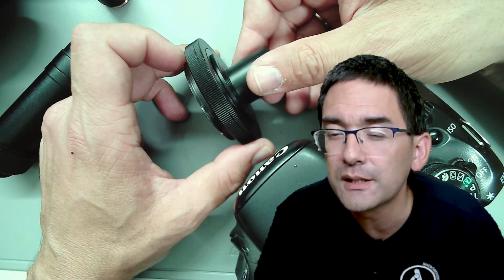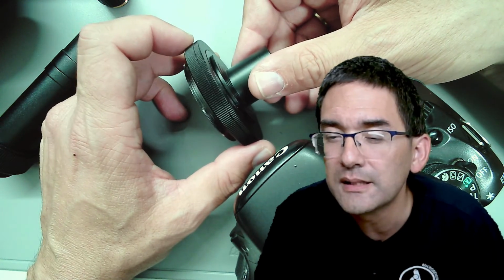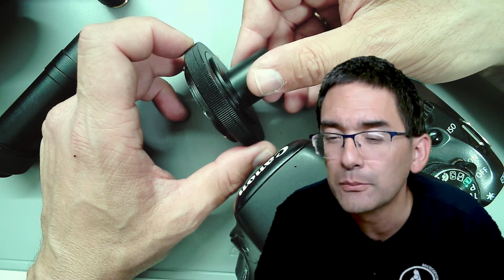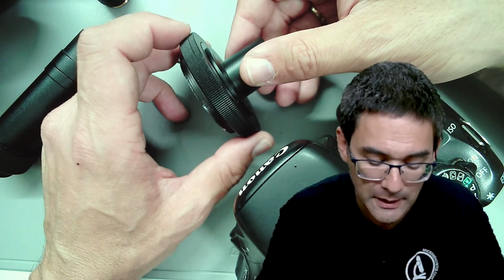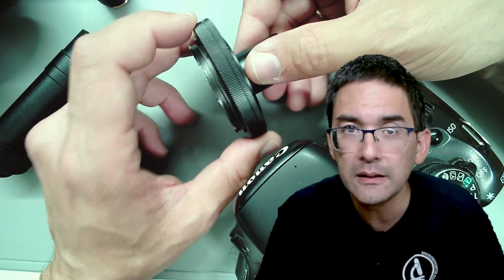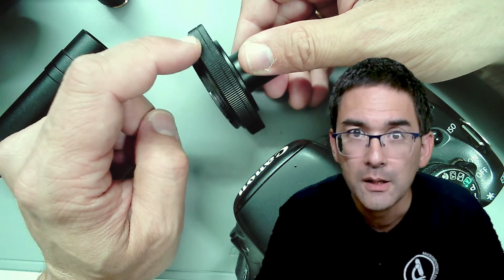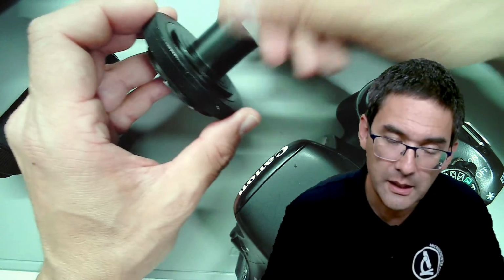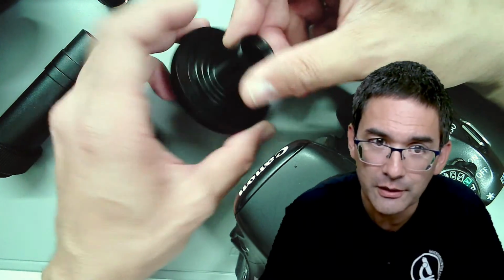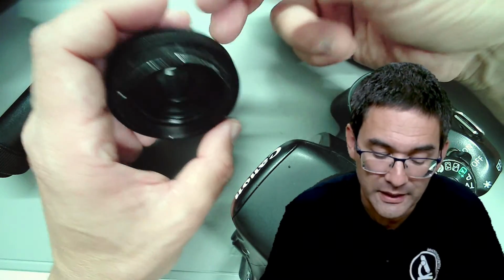Is there a difference in connecting a Canon DSLR to a Nikon DSLR? Does the sensor size matter? Do you have an Amazon product link for a Nikon adapter, sensor cropped? Okay, so I'll talk about this next. The difference between the Canon and Nikon adapters is this T2 ring. So you need to get a Nikon specific T2 ring. But as I mentioned, forget about this adapter here, because it has this disadvantage of not being the correct distance.